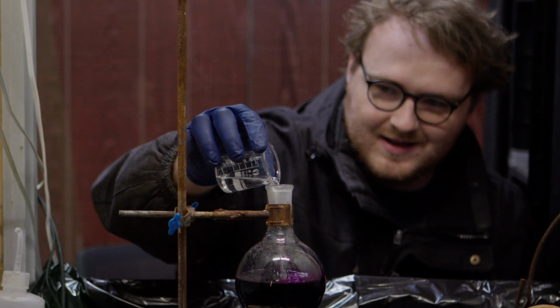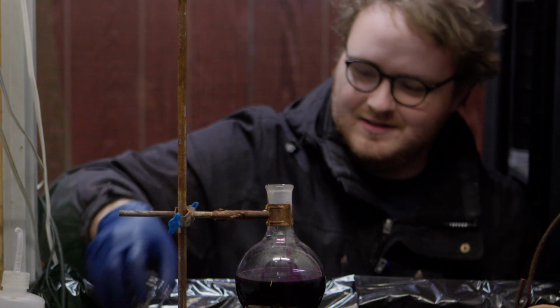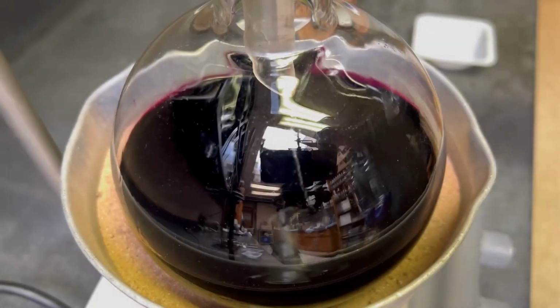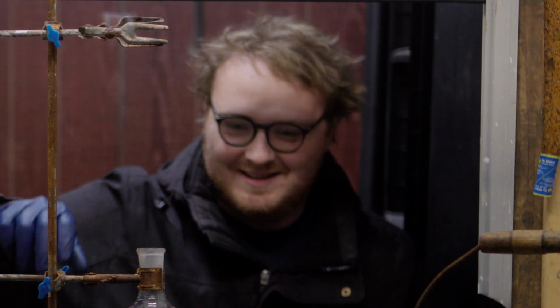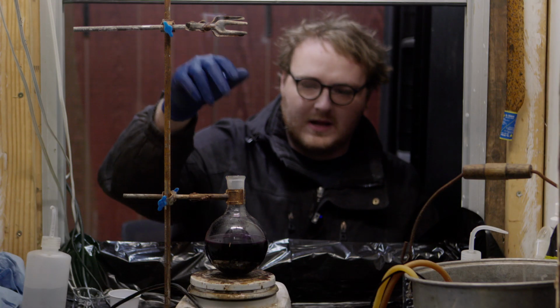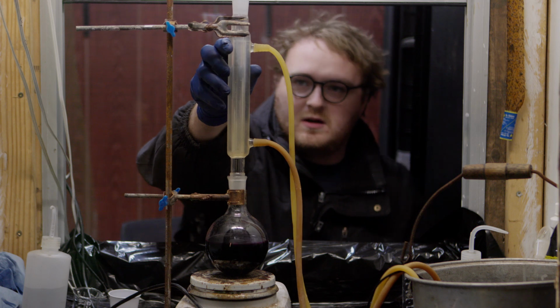If you watch the Wheeler Scientific, he pronounces it a little differently. 30 milliliters of toluene. The toluene is in stoichiometric excess. Kind of funny, but I mean, thank you for the procedure. So we're going to heat this up, and to prevent the vapors from sort of escaping, we're going to put this reflux condenser on top.